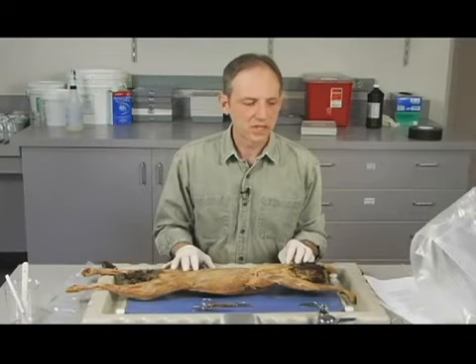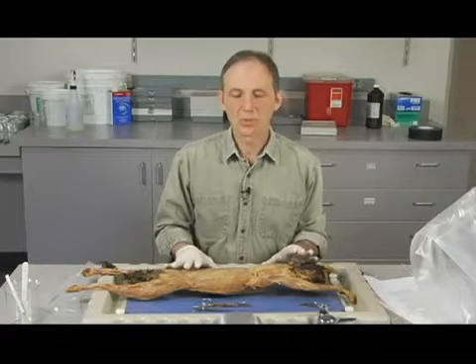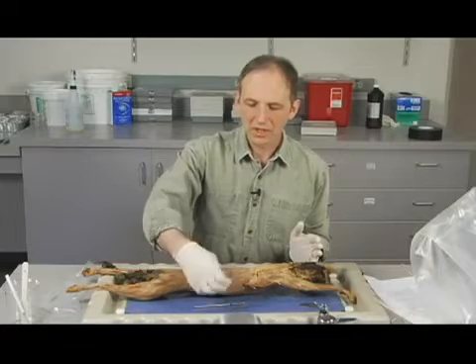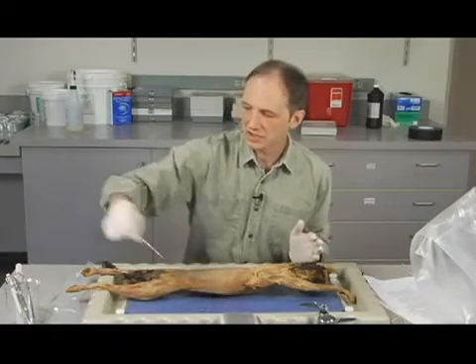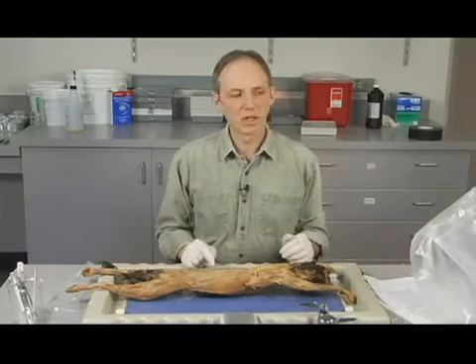So once we've gotten to this particular section, essentially what we want to do is get our material put away. The very first thing I'm going to do is just pick up my implements and stick them back where they belong. In this case, it's in a little beaker here. And the cat, of course, is going to go back in the bag.